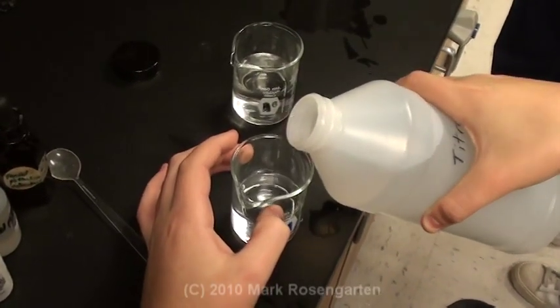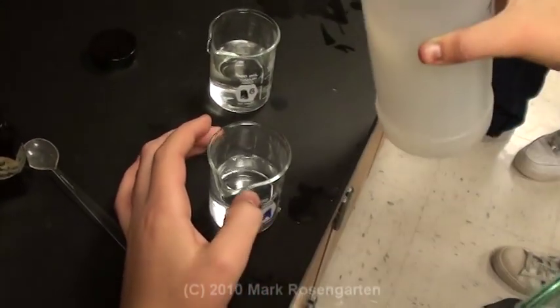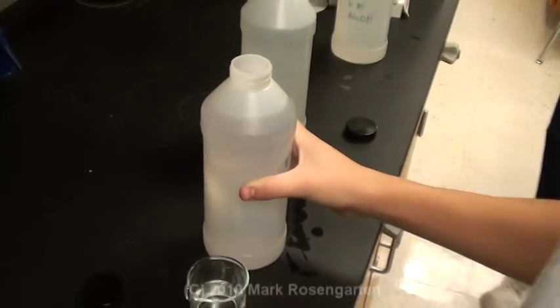First step, measure out 60 milliliters of the acid and the base. Make sure to cap the container after you measure it out.